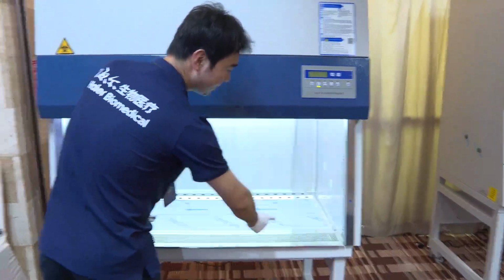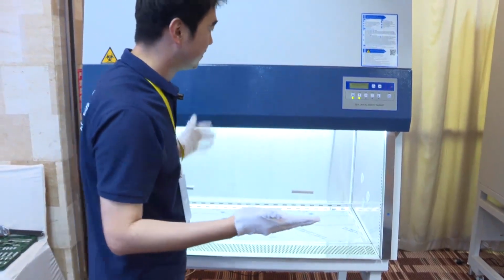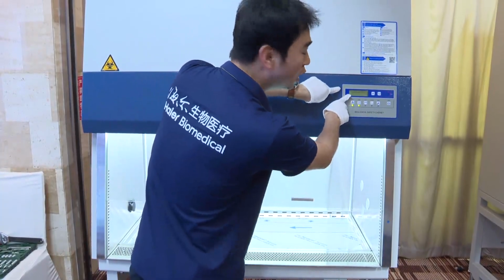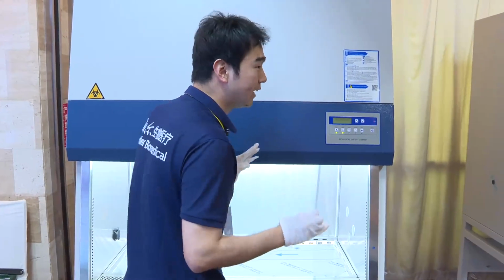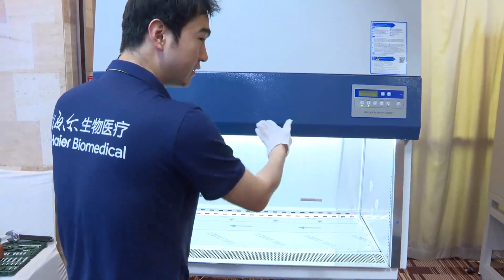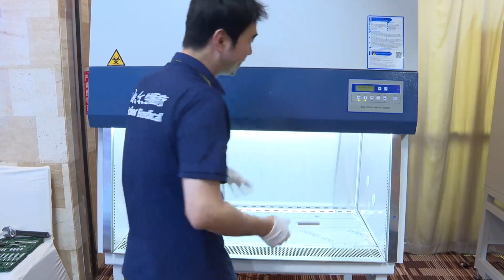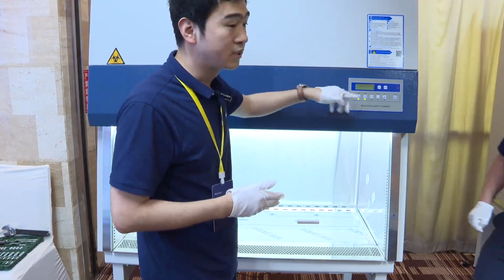If we start here and want to use this, maybe sometimes we will go too high, and here it will show us a door height alarm. It means this is too high. Maybe there is some damage, some air will go out. So we need to let it go down. But even if we bring it down too much, the door height alarm still happens.